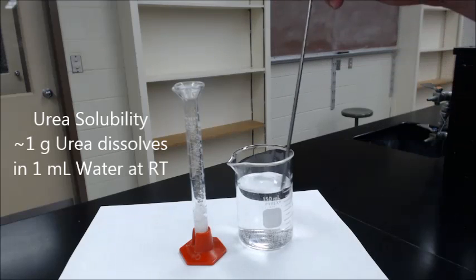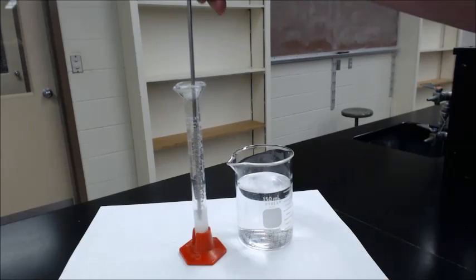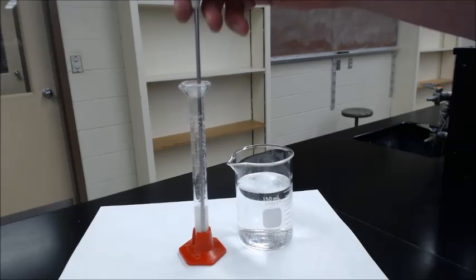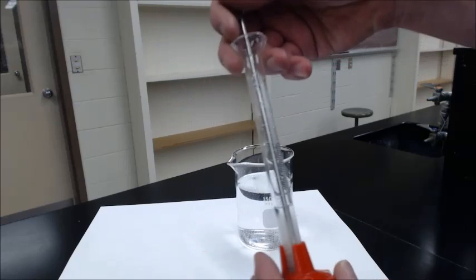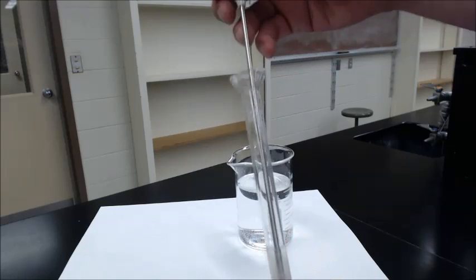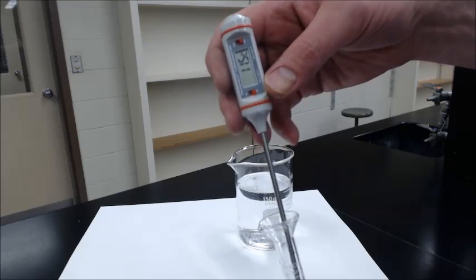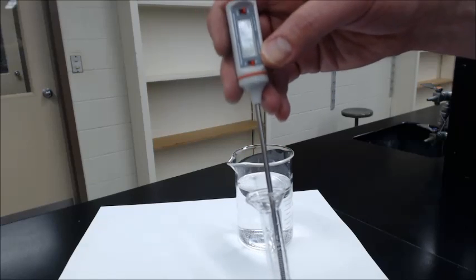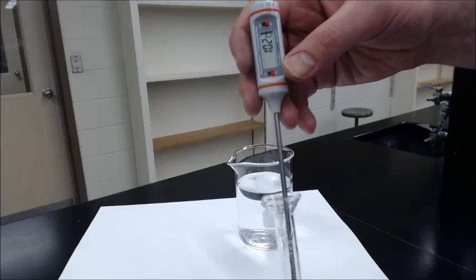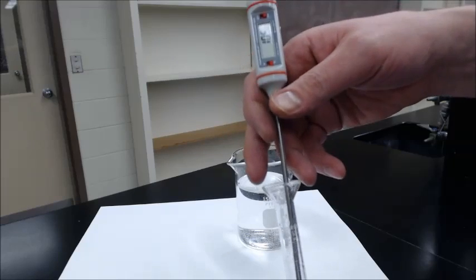Okay, hopefully that didn't add too much water. But we're going to find out here when we start adding it in. This reaction right here is endothermic. Look how much the temperature has gone down. So this is a problem, because we're trying to find the solubility at 25 degrees. So what can we do?